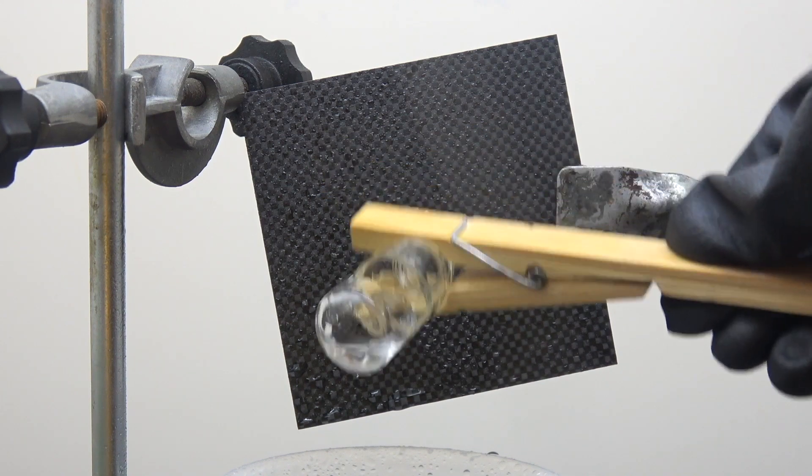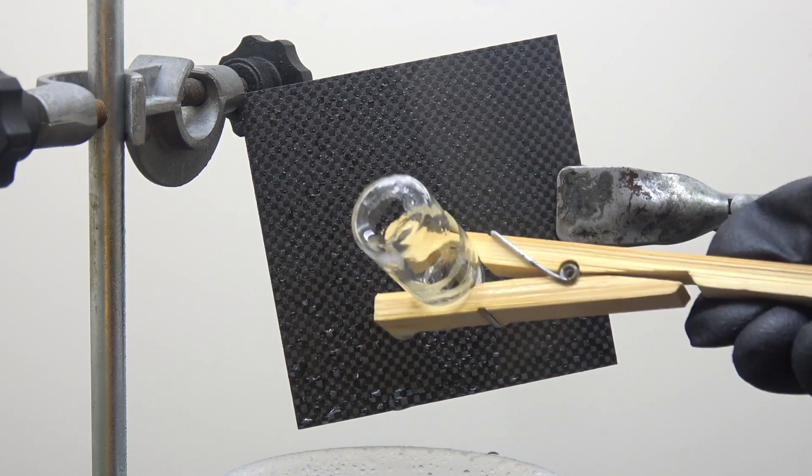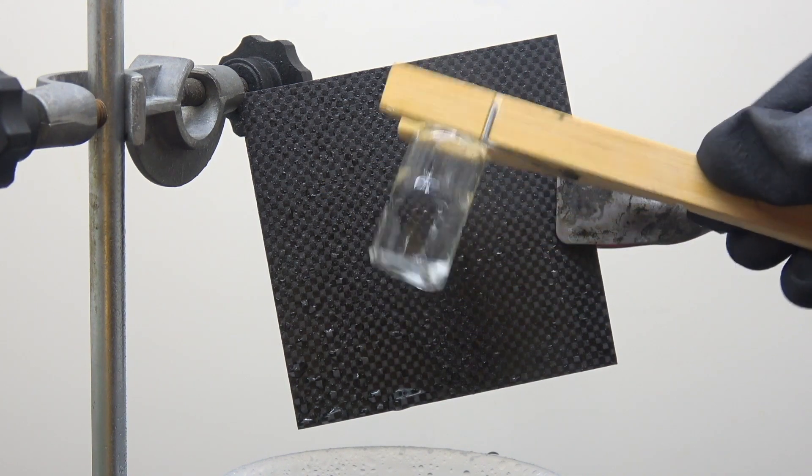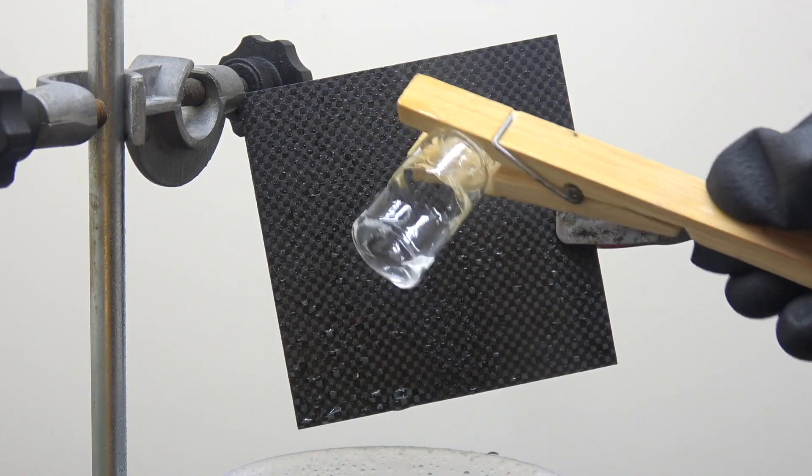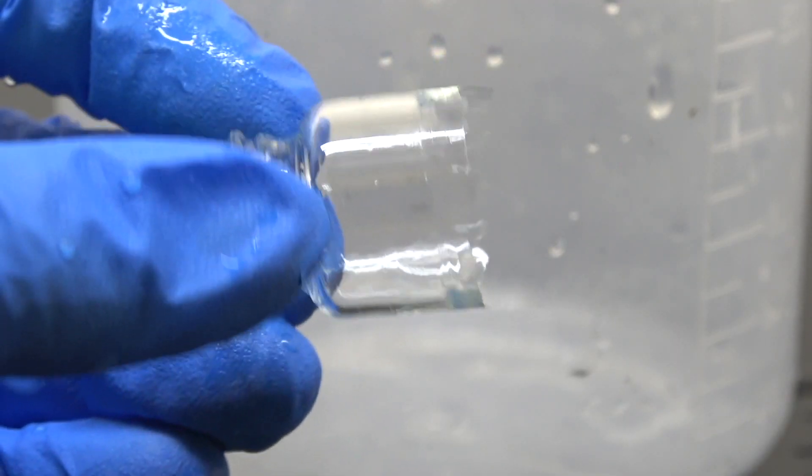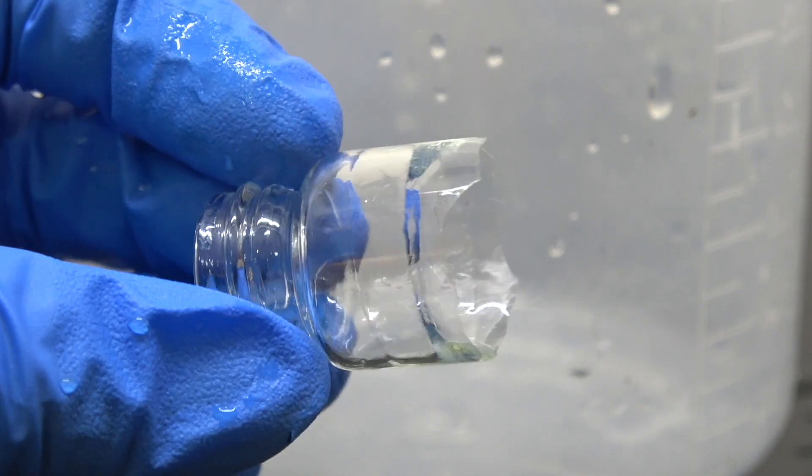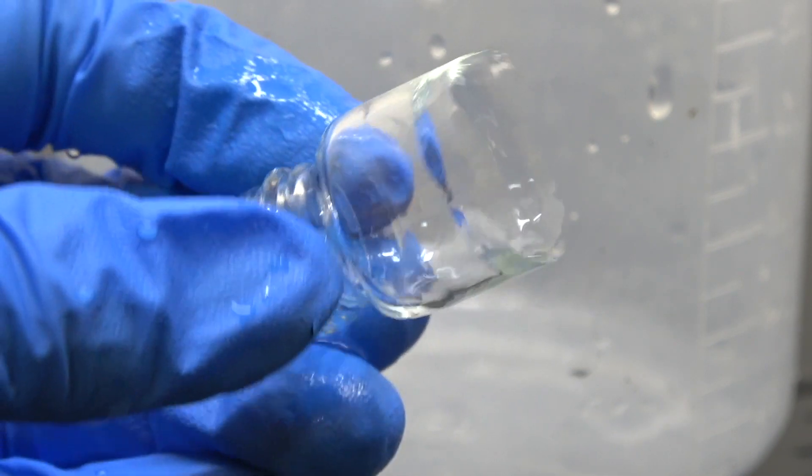The remaining part of the vial felt so fragile. I felt like just by spraying on it, I might snap it in half. And snap it in half it did. It happened when I was trying to put it down.